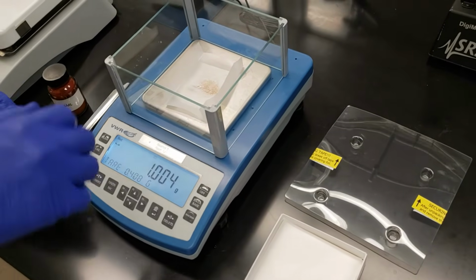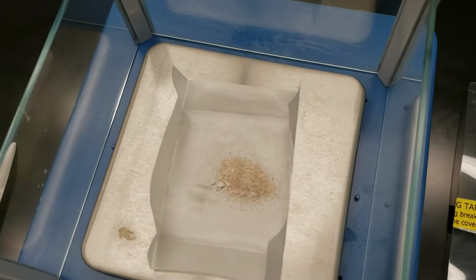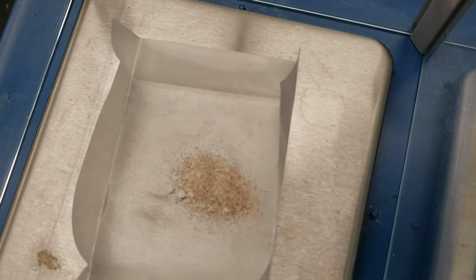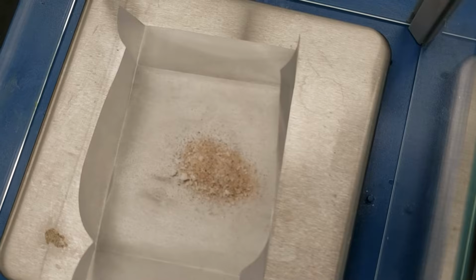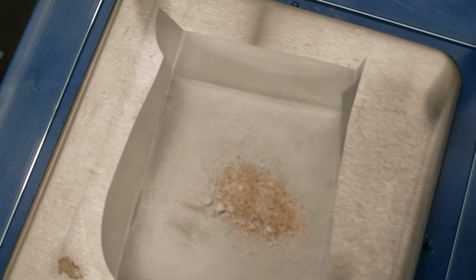Now I'll take this, let's do a close-up real quick, and what you'll see is white crystals with light brown grains of sand in there. So what we see is that heterogeneous mixture. When we go through the next process of recrystallization, we need to keep in mind the idea that we will not be dissolving everything in this sample. So let's take this out, and we'll bring it over here to our hot plate.